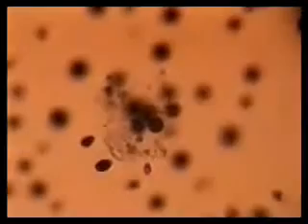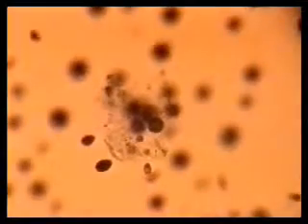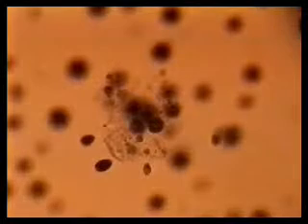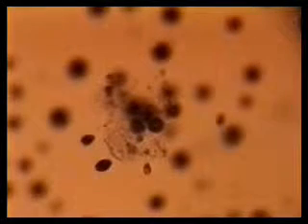Now we're going to move to a different focal plane to bring a different organism into focus, and capture an image of that one, and then we'll take a look at that same organism in focus with Brightfield. There it is.